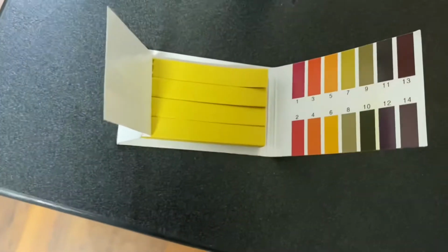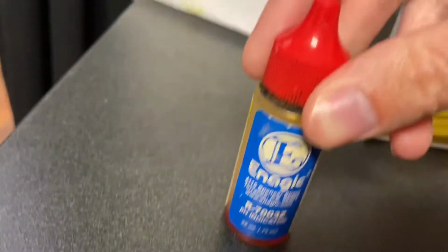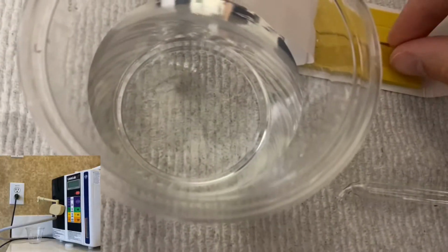Now for the actual experiment. So I have here two common instruments used to measure pH, the first being the actual test strips, and the second being a pH indicator solution. The latter option seems to be more accurate in determining the value, however we'll be utilizing both to support our results. At home, I have a water filtration machine that can dispense solutions with specific pH values.